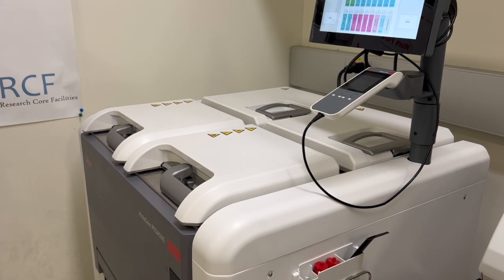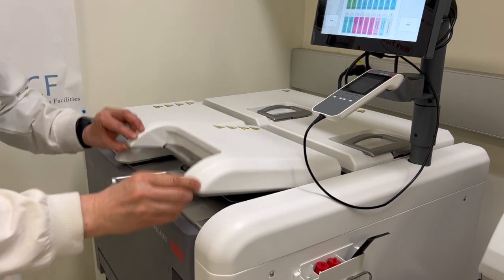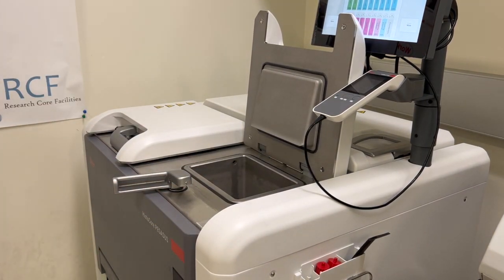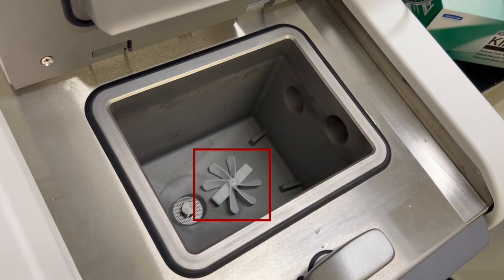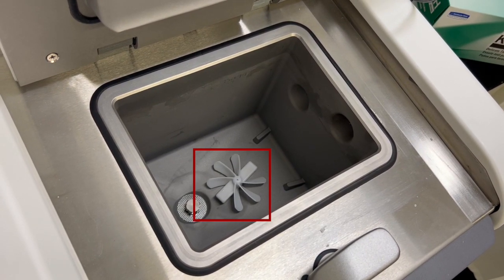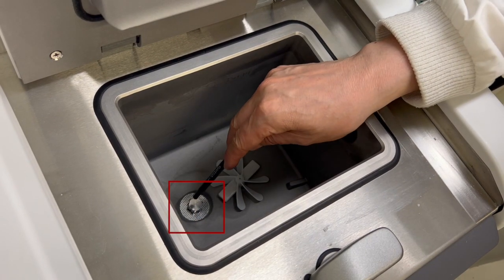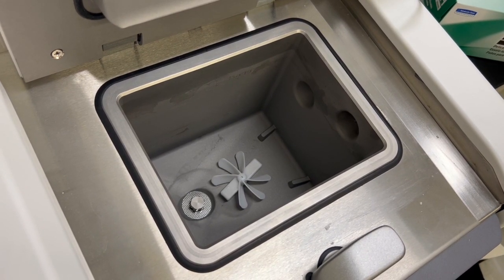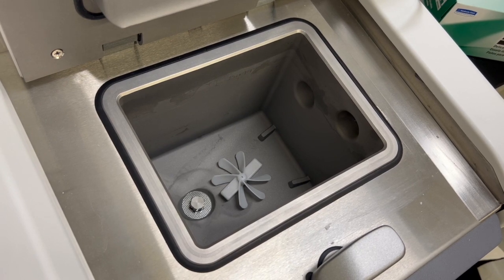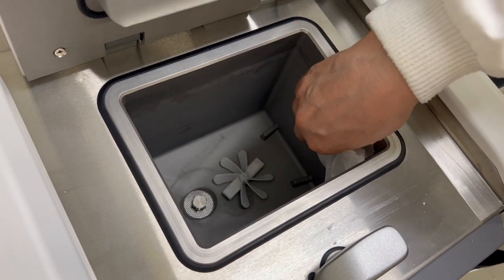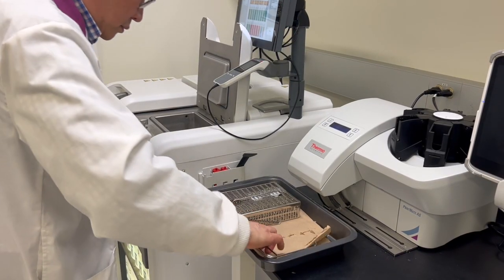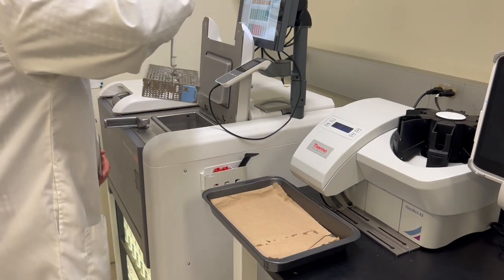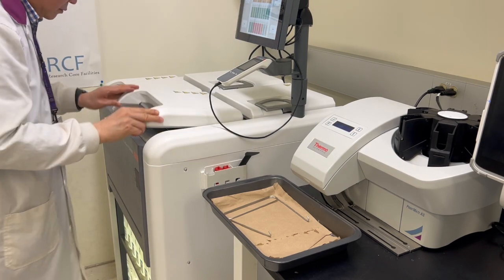To open the retort, use the handles in the front of the instrument. Turn the handle clockwise and open the retort lid by lifting the front end of the lid. Each retort has a magnetic stirrer, which stirs the reagent or paraffin to ensure a consistent temperature and good tissue penetration. Each retort also has a sieve at the bottom. You should check to see if the retort is clean or that any residue is a reagent compatible with the first reagent in the protocol. Only use Kim wipes to wipe the inner layer of the retort, especially to wipe the two fluid level sensors. Next, you will need to prepare the cassettes and put them into the baskets. After this is done, you can put the baskets into the retort and close the lid of the retort.